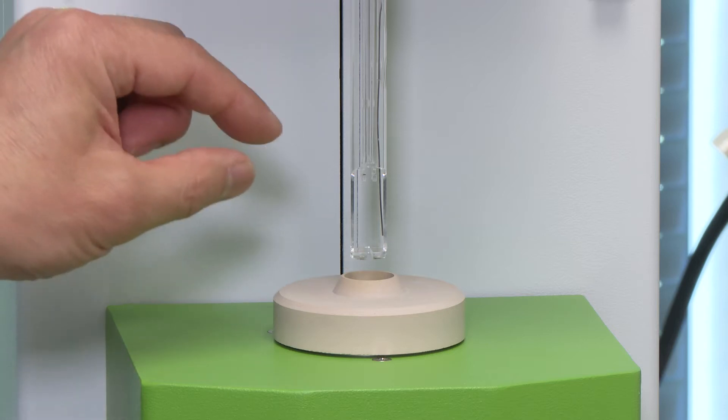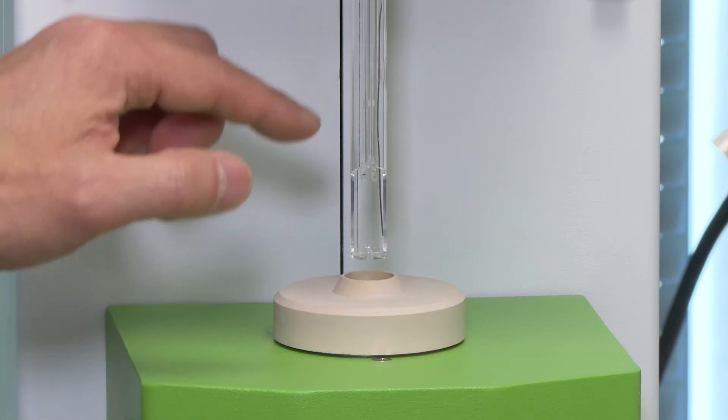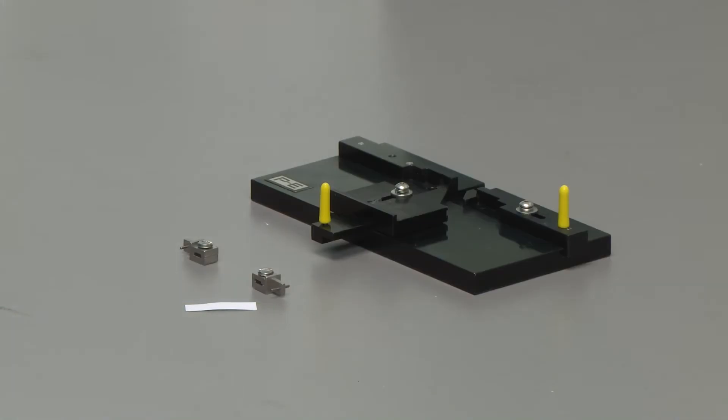Right now it has a different platform and different probes and we are going to use special clamps for the film samples.